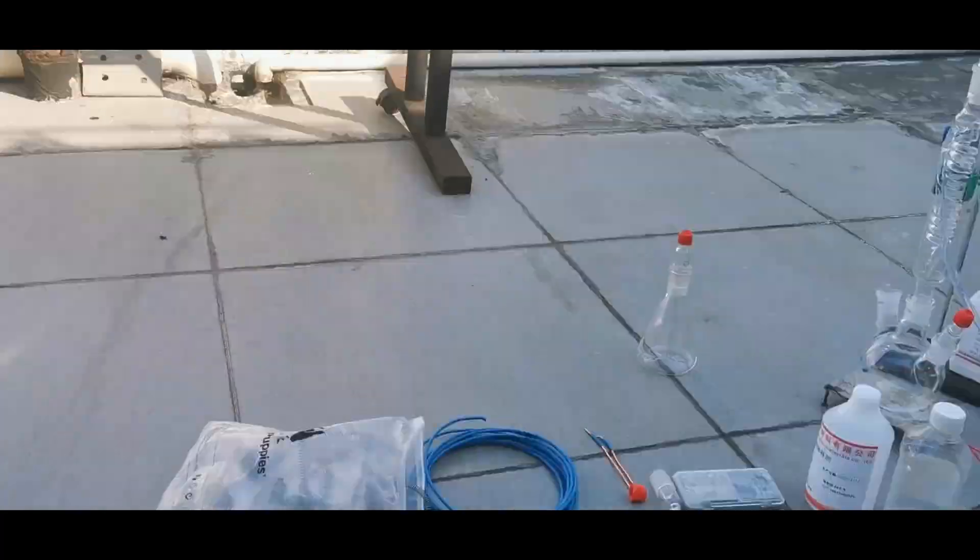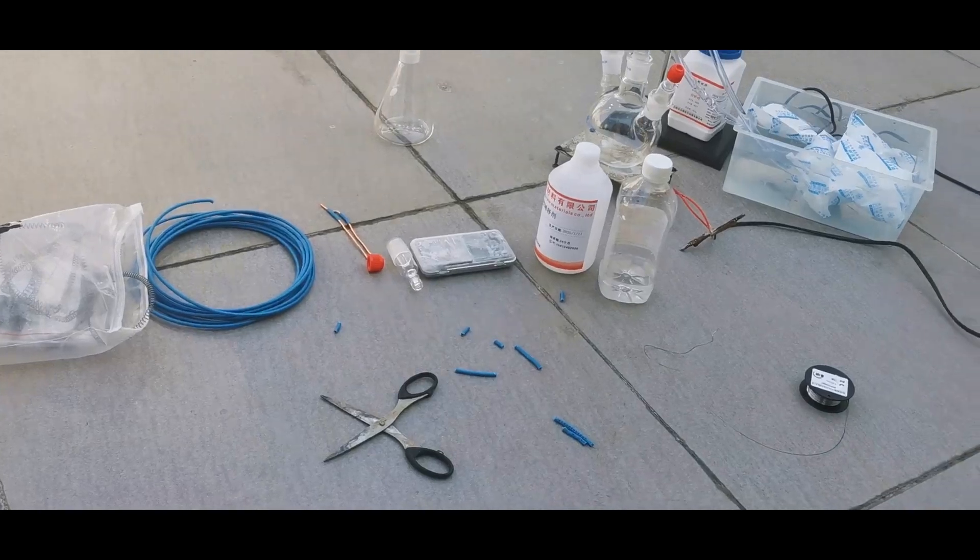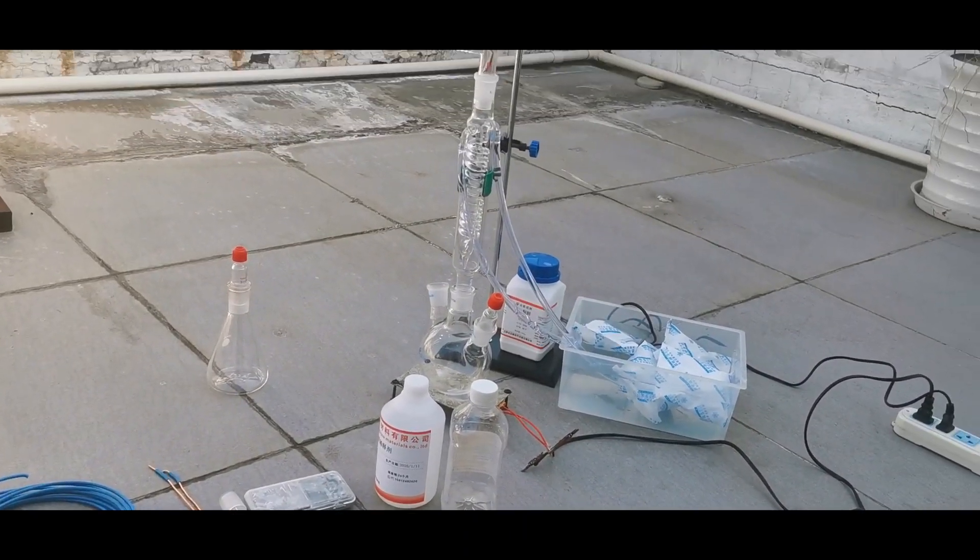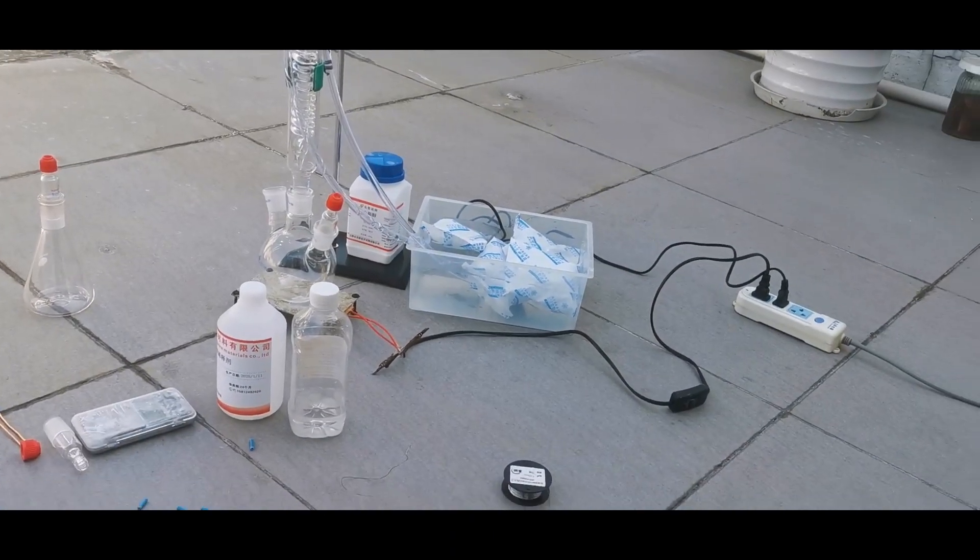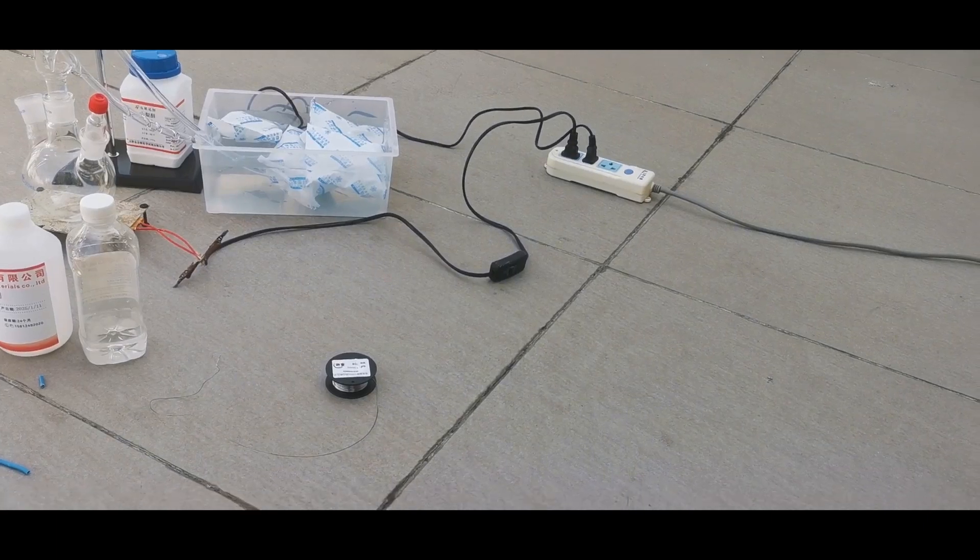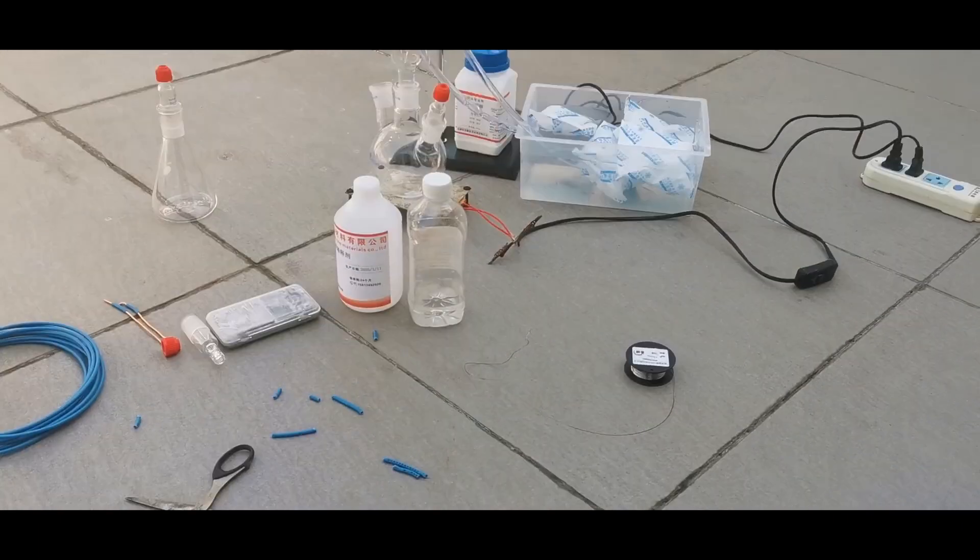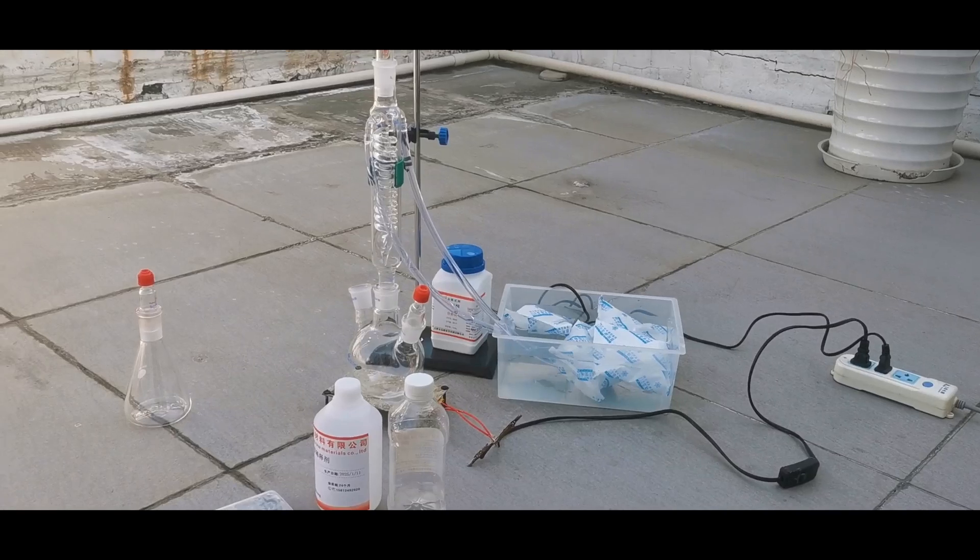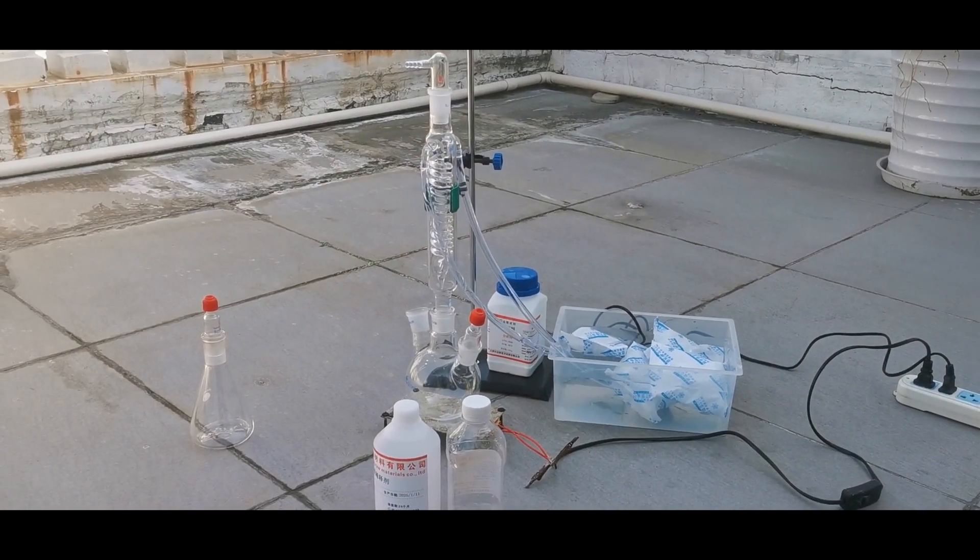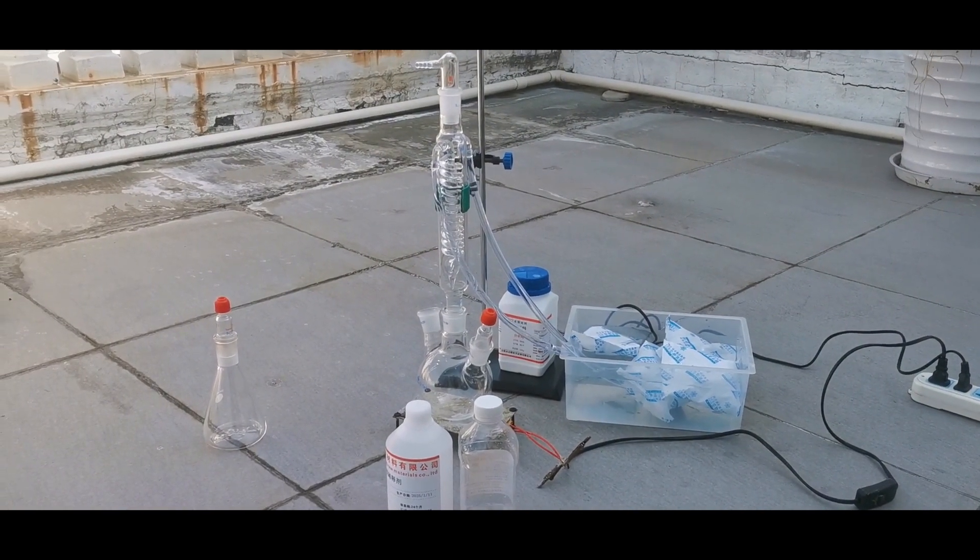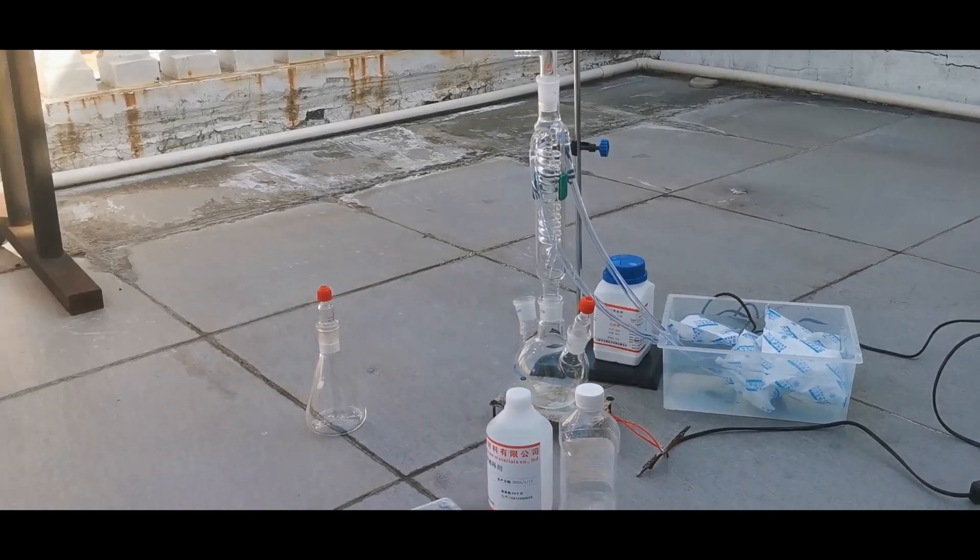The only disadvantage of the ketene lamp method is that it requires quite a complicated apparatus, including a heating filament, at least one condenser, and a trap. I used a very skillful moving shot to display most of the stuff that I used, including copper and nichrome wires, acetone and acetic acid, some glassware, and the reflux water reservoir filled with ice packs.